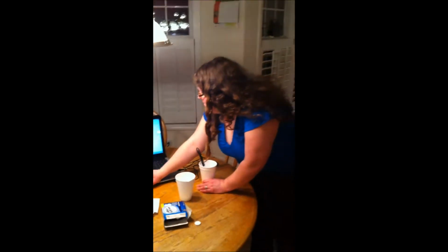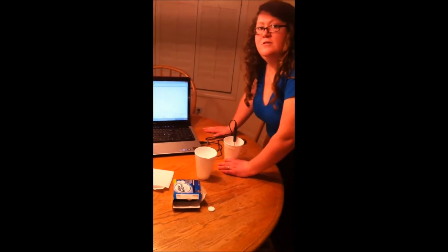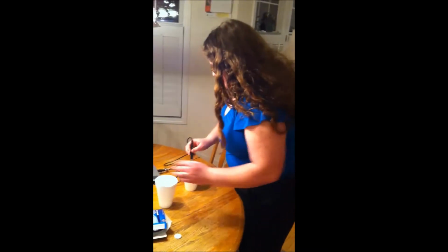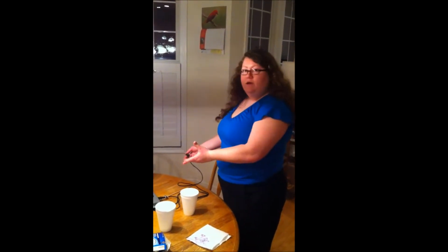All right, looks pretty stable now. So we're going to stop collecting data, and our reaction time is going to be when it started to level off. Looks like it was at 68 seconds. So what did you guys get yesterday in your trials? Dave? 70. 70 seconds. All right, so is that pretty similar? Yes. All right. So we've now seen that using the temperature probe gives an accurate way of seeing how long a reaction takes to occur.